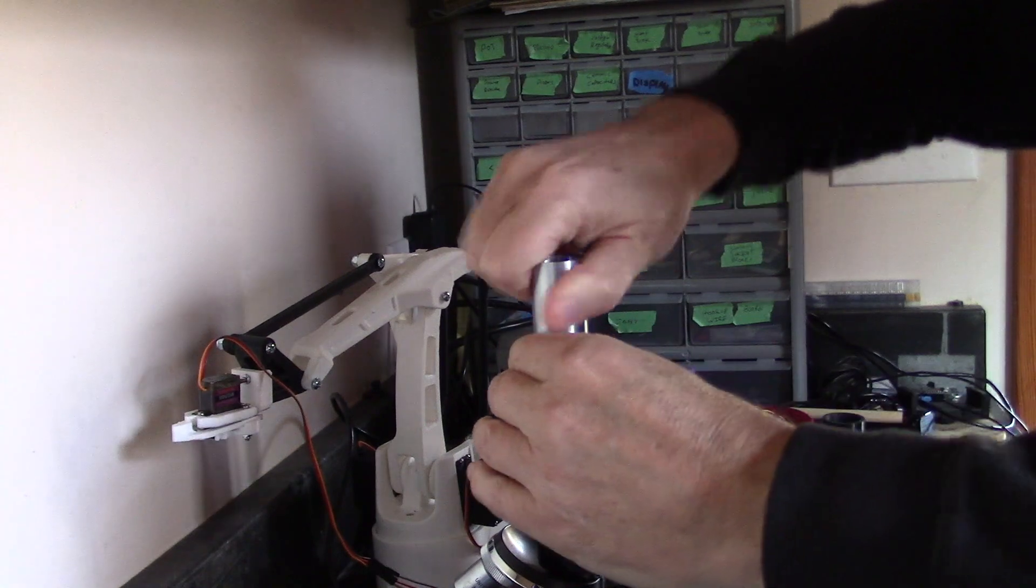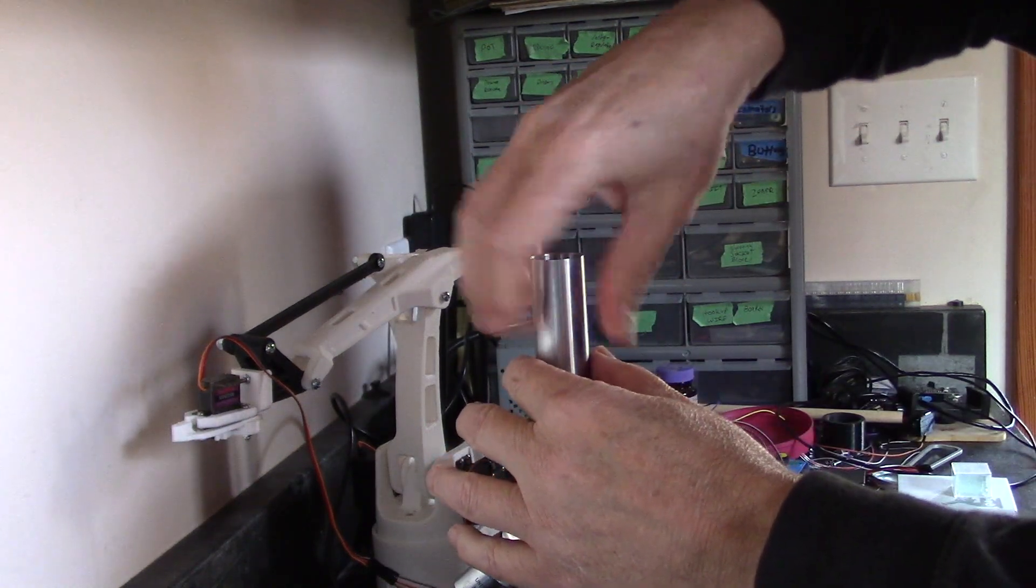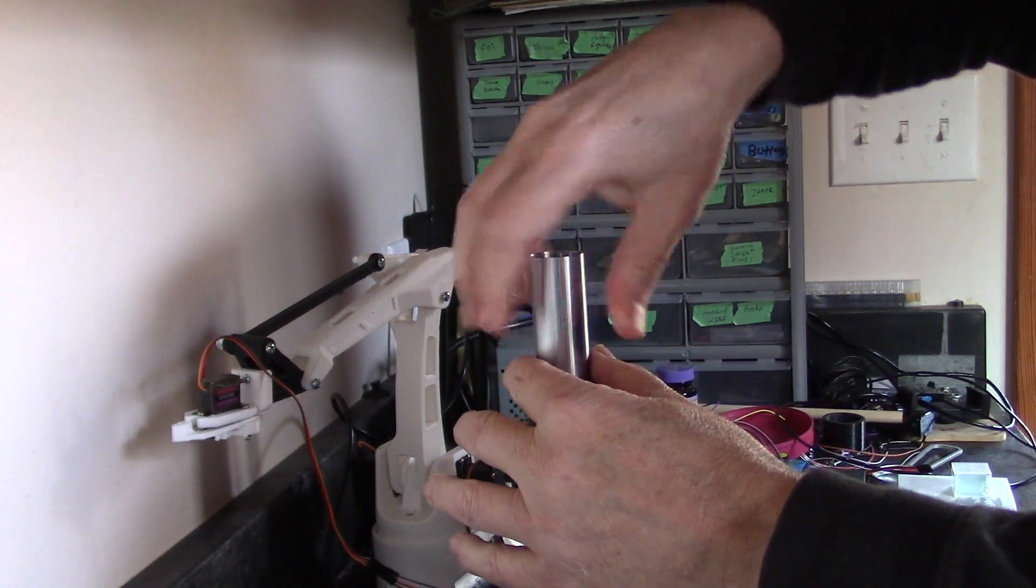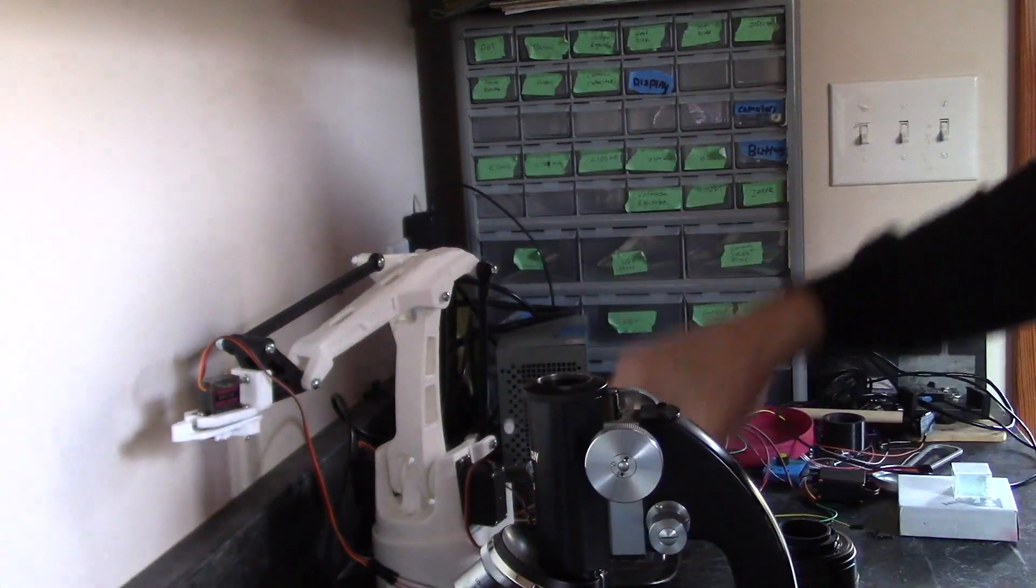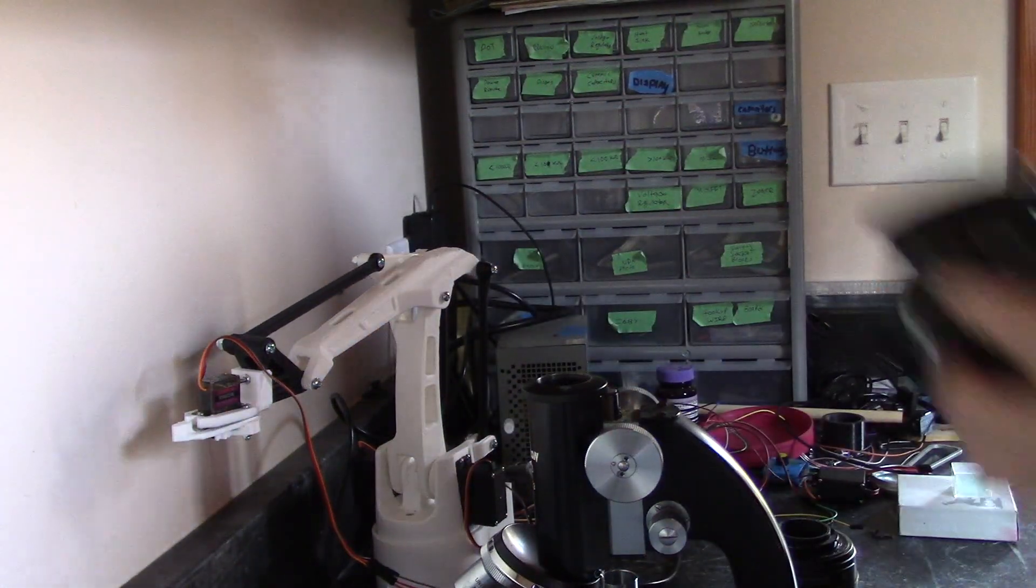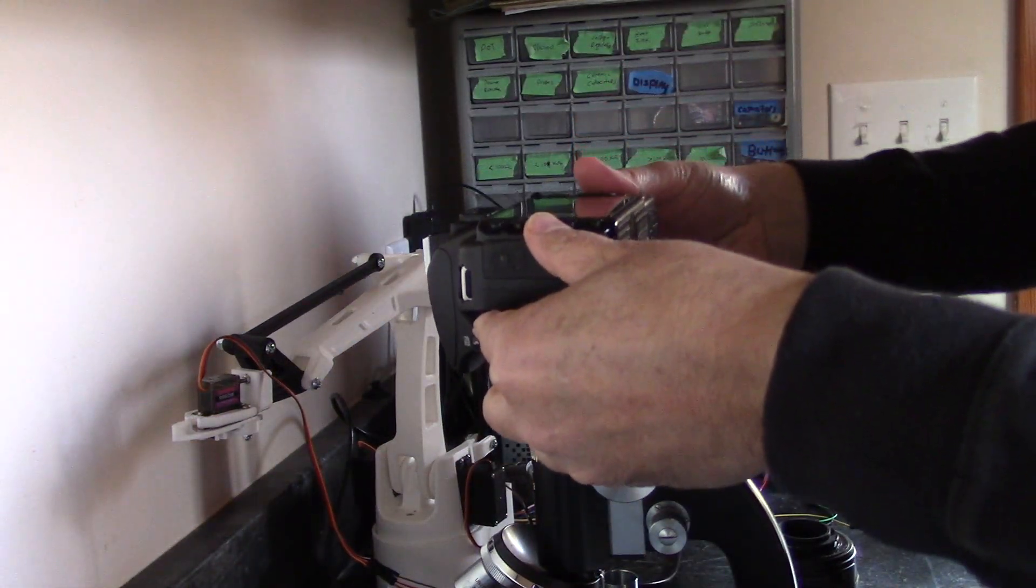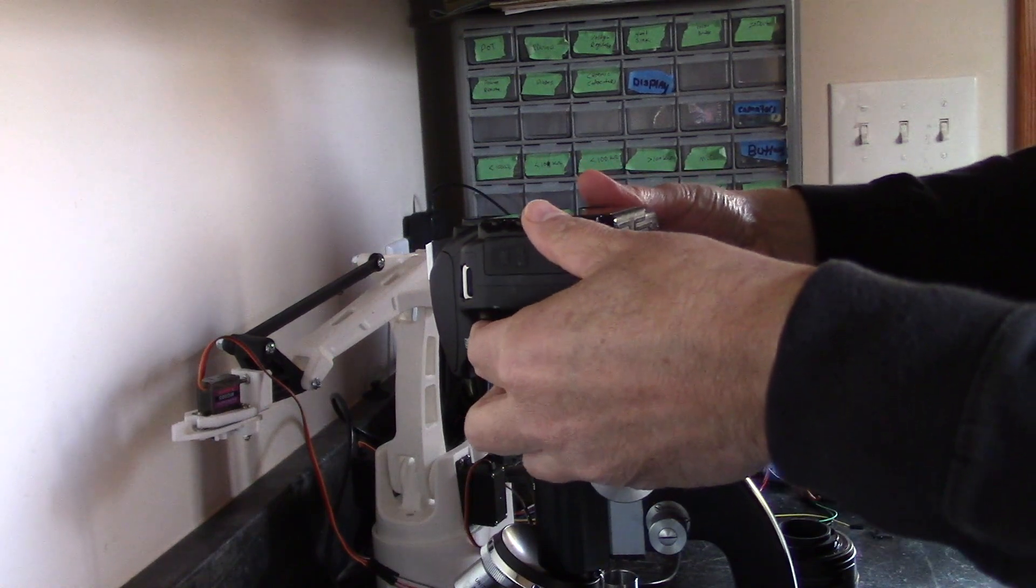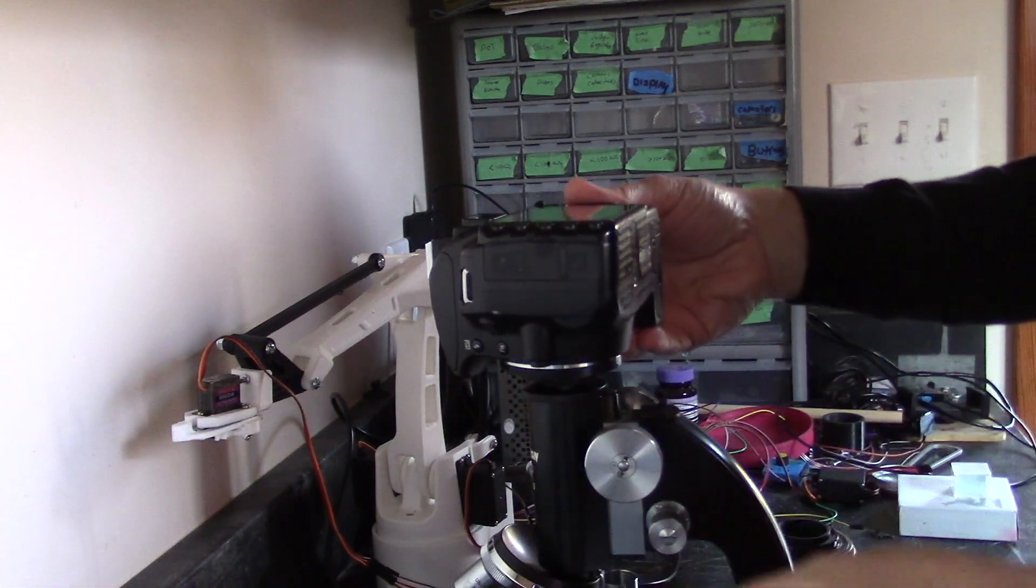And so what I have to do is I'm just going to remove this. Okay, and now you can put it down in here. Now the issue with this is that now it flips a little bit cannywampus, okay.